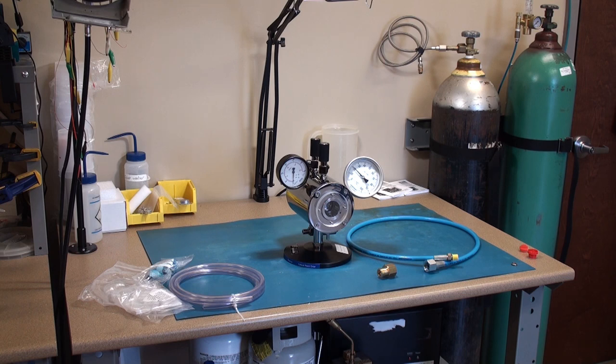We sell a lot of these. Actually, this model dates back to the mid-80s. It's a quite simple, strictly mechanical design, completely manual, and therefore is relatively trouble-free from issues that more advanced computer-controlled units might present.